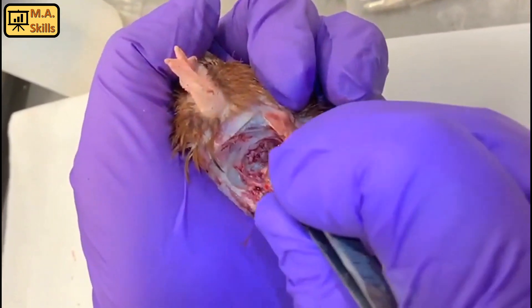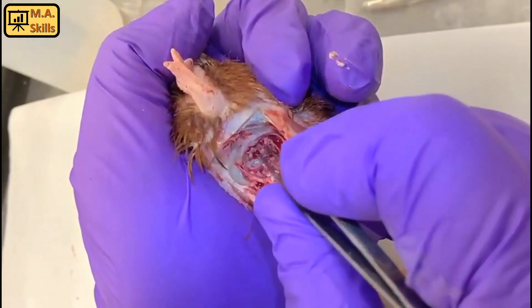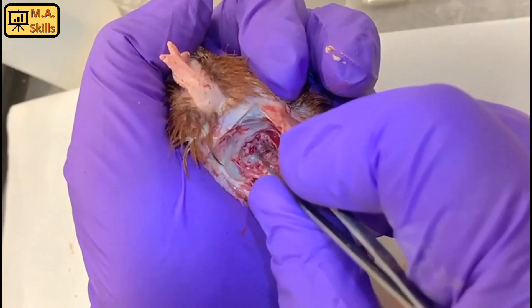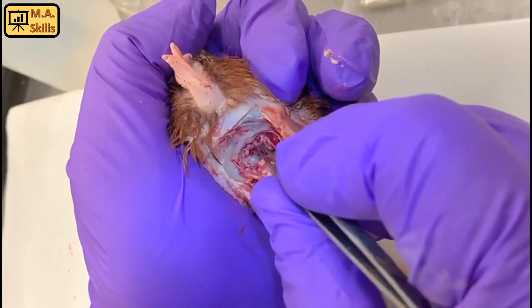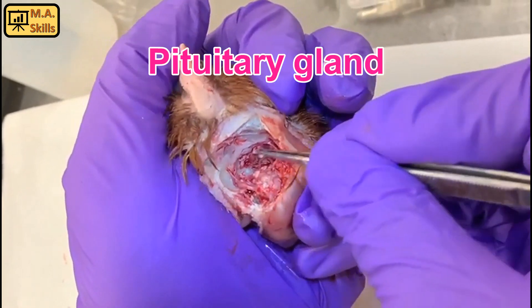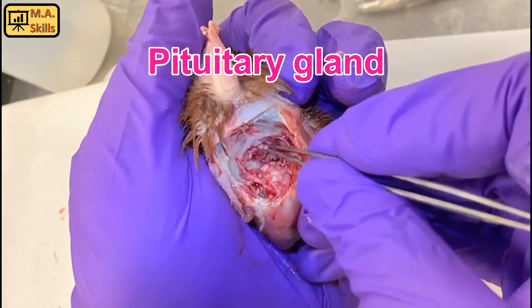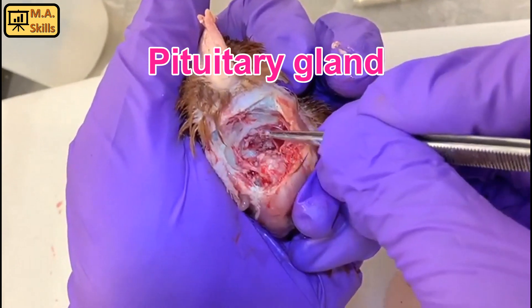By doing that we can access the pituitary easily. And here is the pituitary gland.